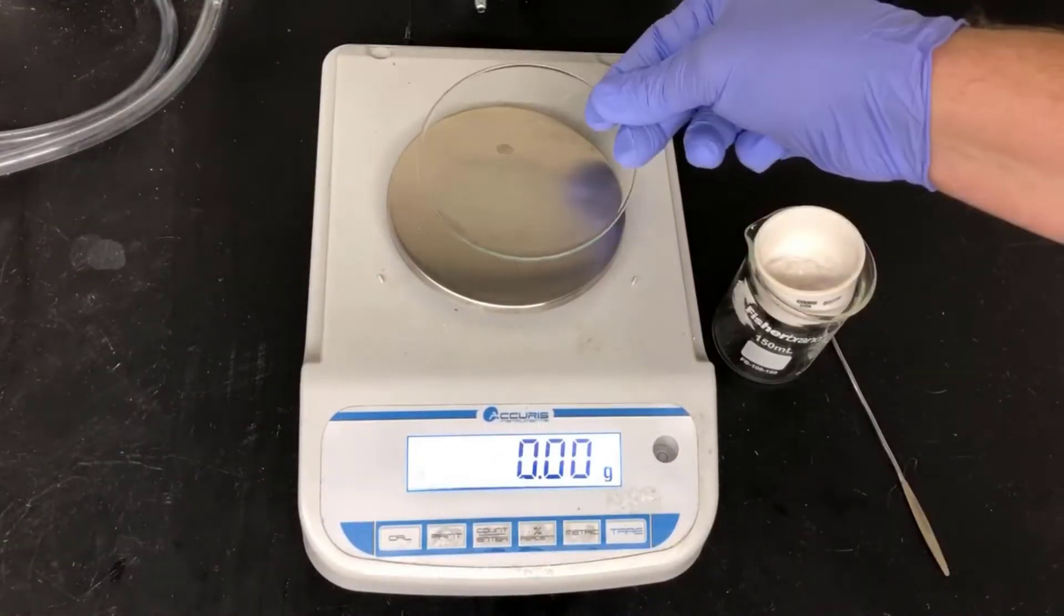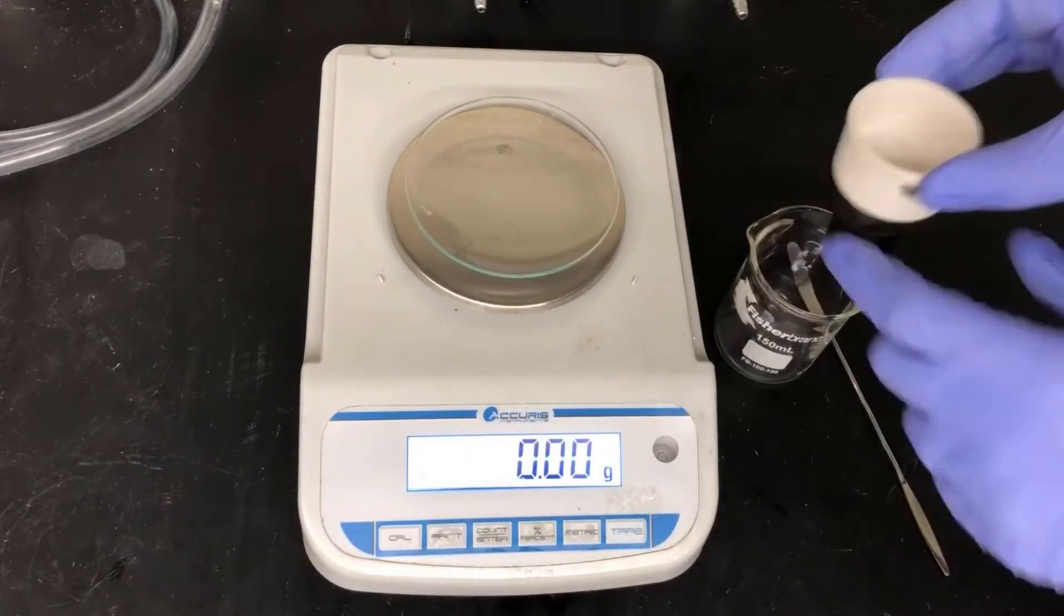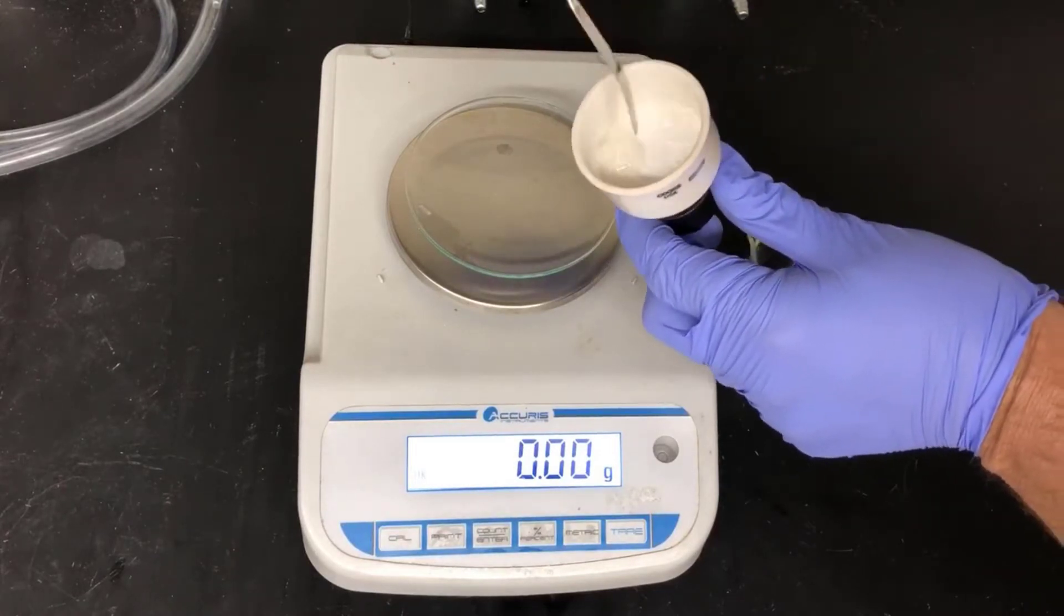I'll be weighing out my product on a watch glass here. So I put the watch glass on the balance, I tare it, and I'll scrape the crystals onto the watch glass to get their mass.